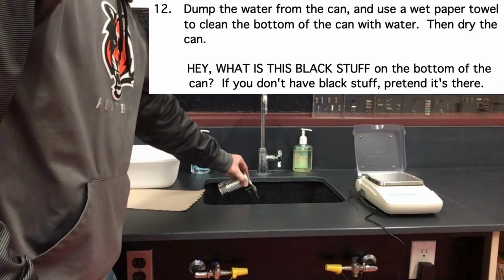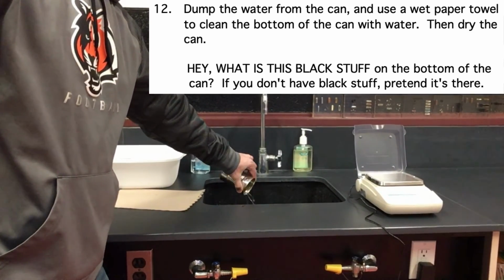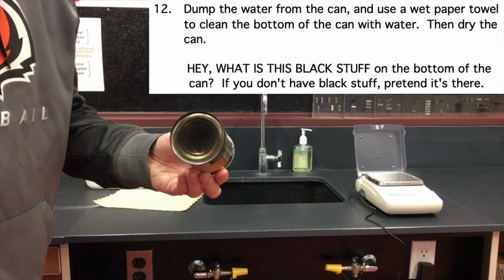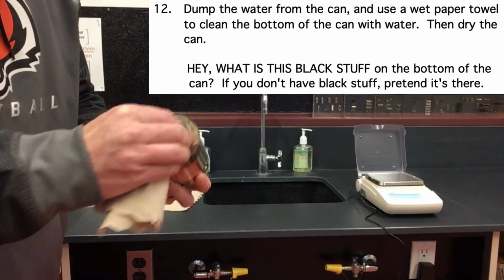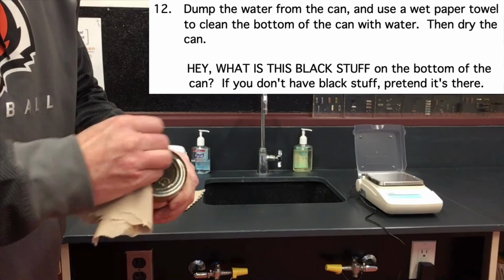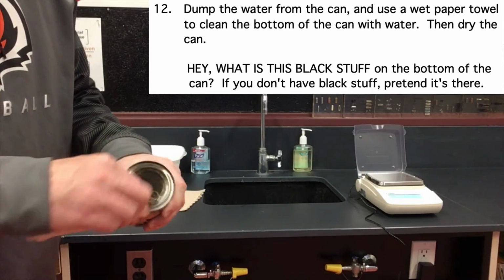We have collected all the data for the lab, so now we can clean up. You will notice that there is some black residue on the bottom of the can. Try to clean this with a wet paper towel and think about what that residue is and what may have caused that residue to be there.